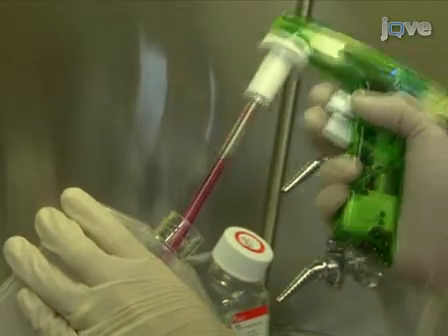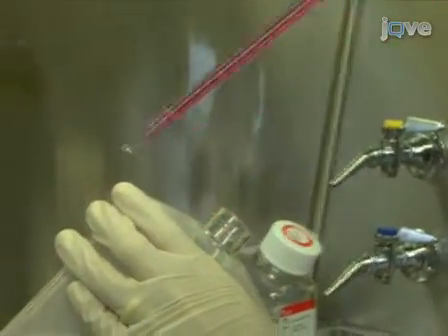I'm Adam McCoy, Senior Scientist at the Gene Expression Division at Bio-Rad Laboratories. Today we'll show you a procedure for easily identifying the best electroporation conditions for transfecting primary cell lines. We use this procedure in our laboratory to study gene expression in these cells.